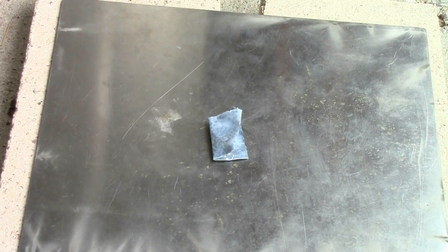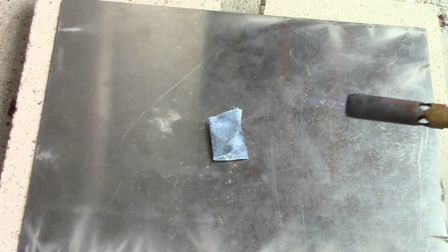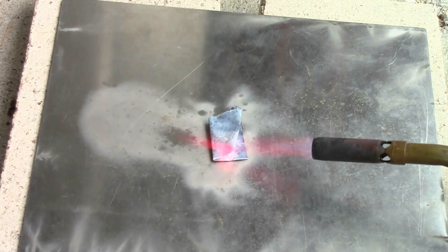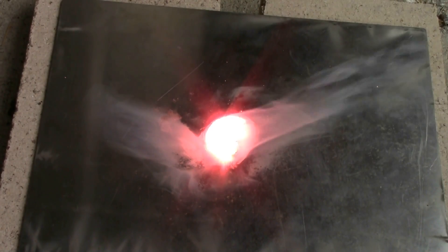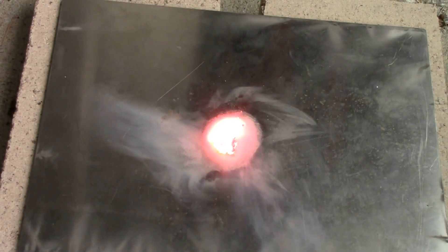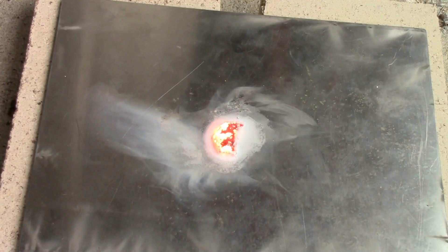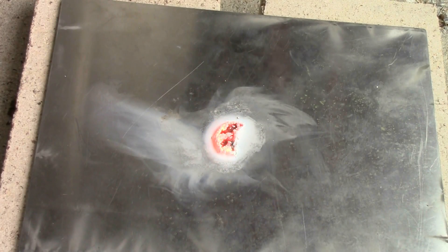Here's a piece of pretty heavily oxidized lithium. Let's see if we can ignite this. Hey nice! See we've got that awesome red color to begin with and when it burns we get a really bright white flame.